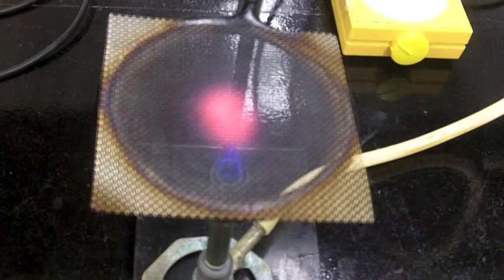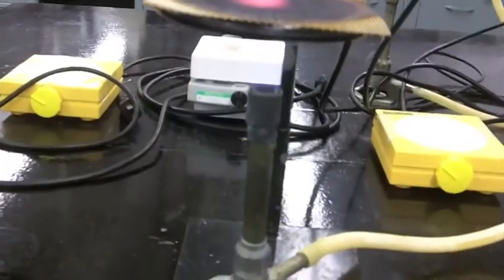The lab has some air currents in it from the air conditioning unit, so it can make it a little bit hard. So this disk I have here is probably a little too small. I should have lowered it just a little bit to make it work a little bit better, but this will be sufficient.